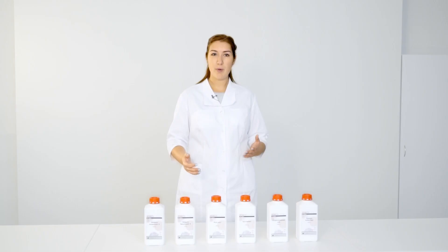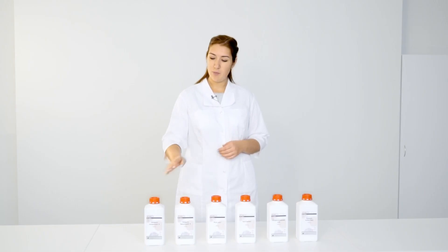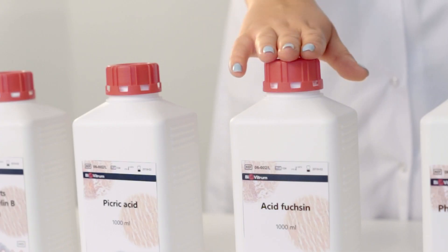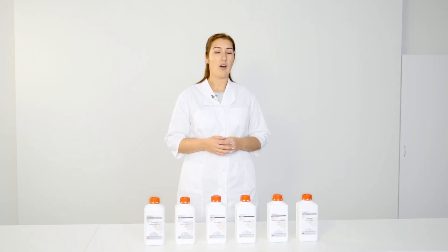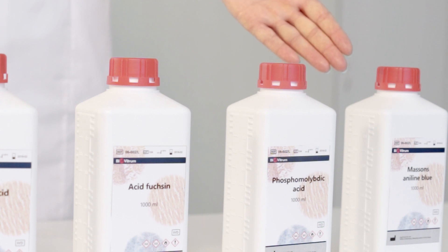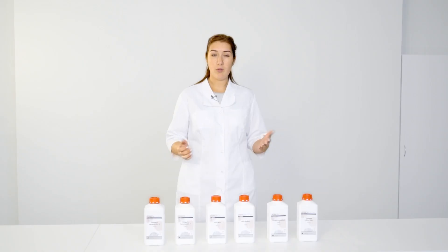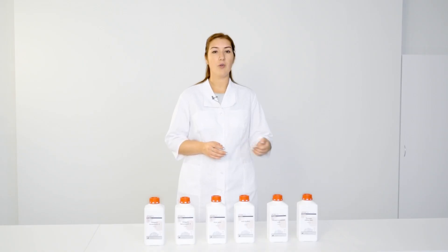On the first step, Weigert's hematoxylin can be used. It should be prepared right before staining as a mixture of solutions A and B — it stains nuclei. Picric acid and acid fuchsin are used to overstain all components. A solution of phosphomolybdic acid, a polyacid, is then used to remove red dye from collagen and some other components by displacement. A second acid dye in turn displaces the polyacid, resulting in collagen stained in a contrasting color. Methyl blue, water blue, or aniline blue can be used.